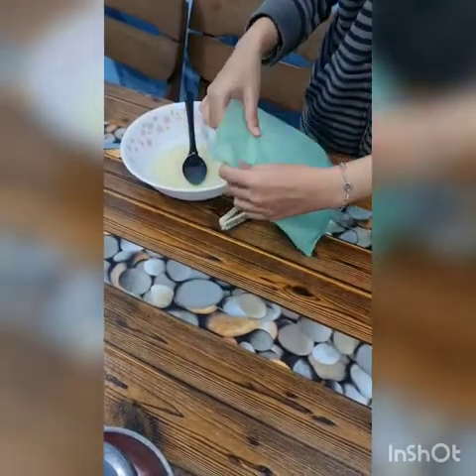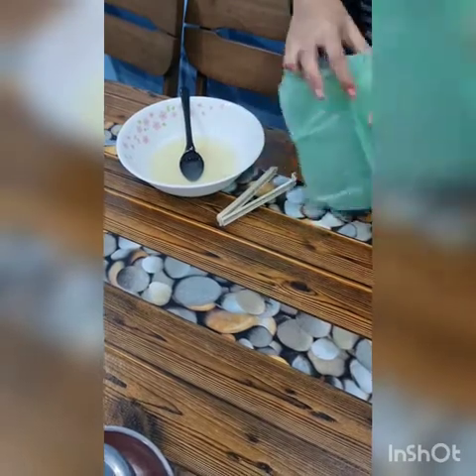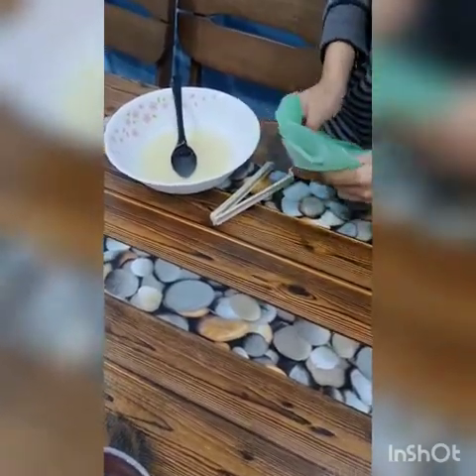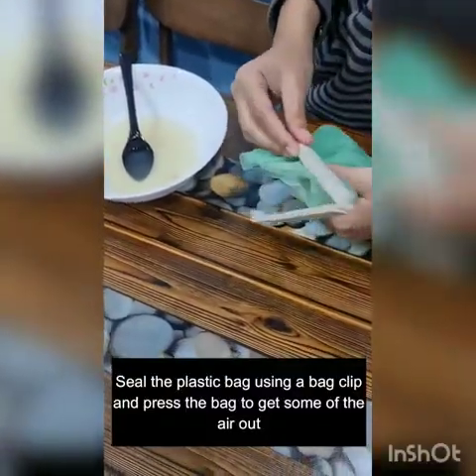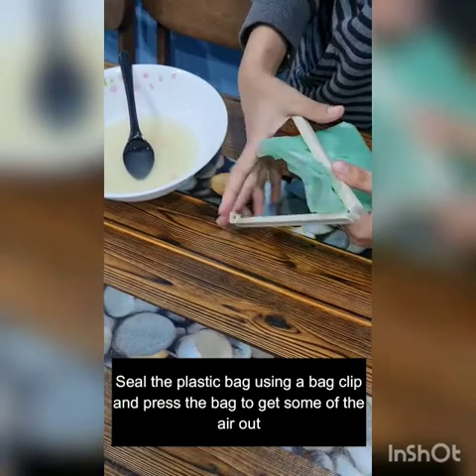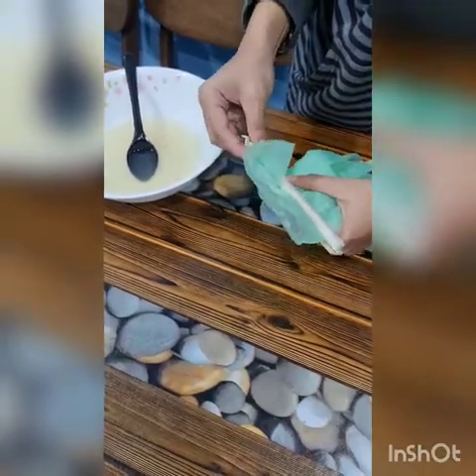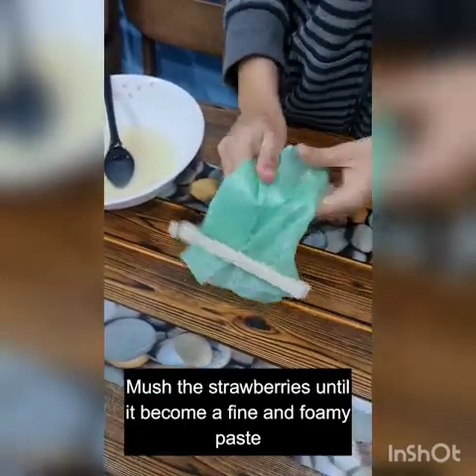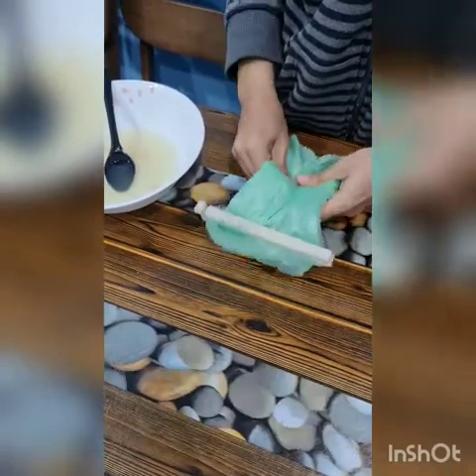Next, the air in the plastic bag will be pushed out, and the plastic bag is then sealed. The strawberries are then mushed until it became a fine and foamy paste.